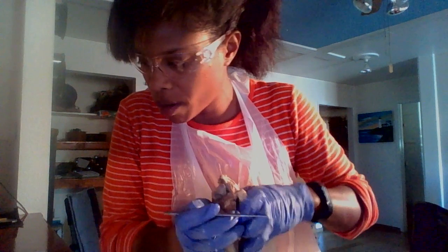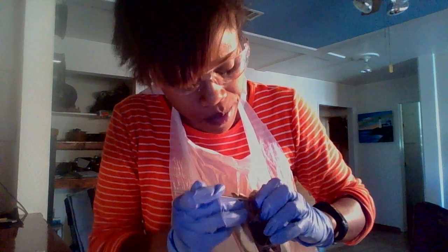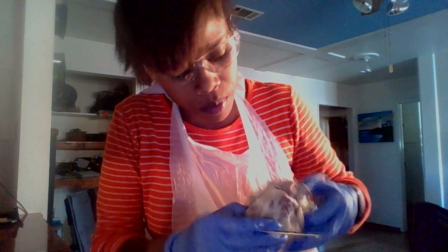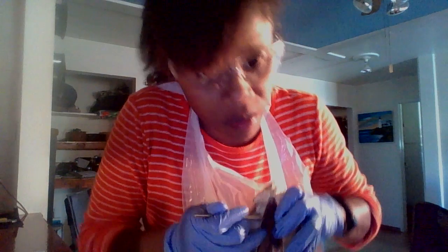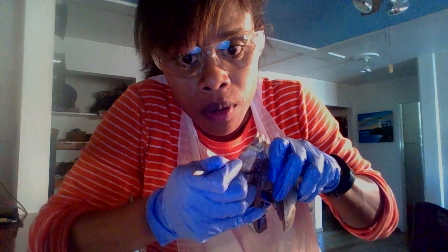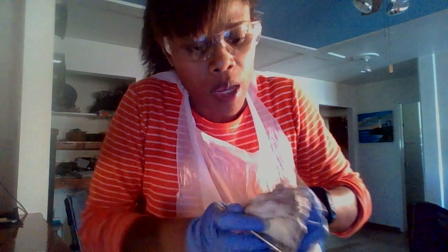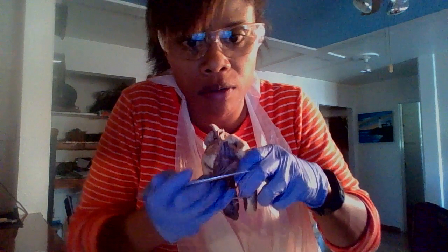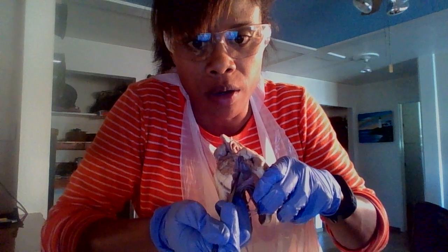The pulmonary semilunar valve is here. And then the aortic semilunar valve is here.